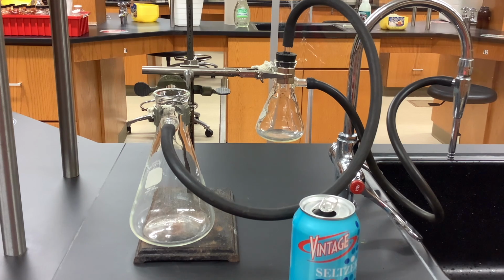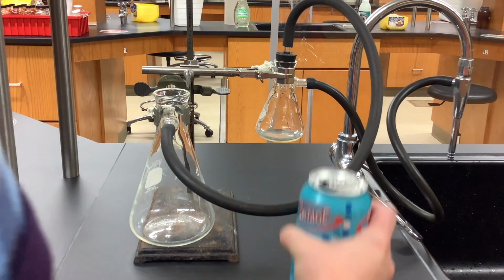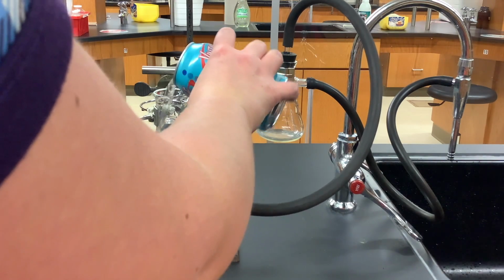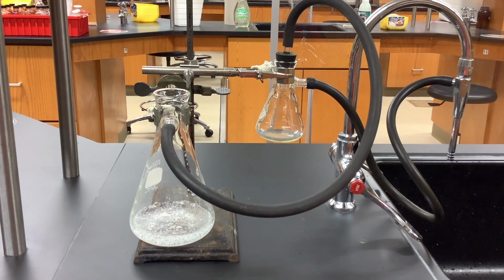When I turn on the vacuum aspirator, I'm going to be decreasing the pressure. We want to see what happens to the solubility of the gas. So I'm going to pour a little bit of seltzer water into my vacuum container, and I do have some bubbles forming here, so I'm going to wait a minute to make sure that they have stopped before I put it under vacuum.